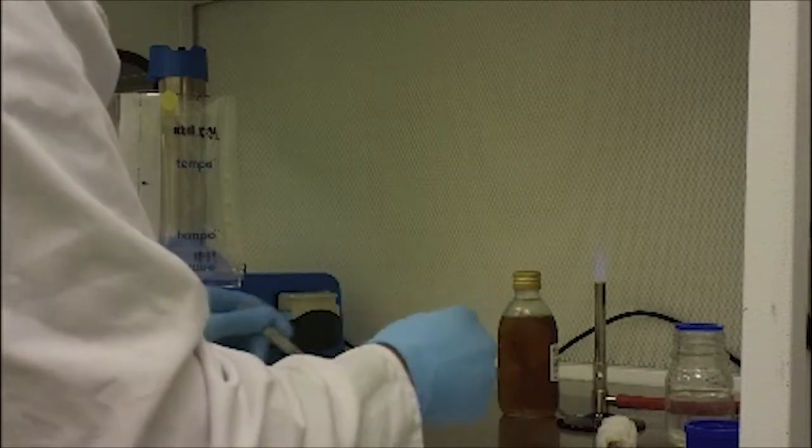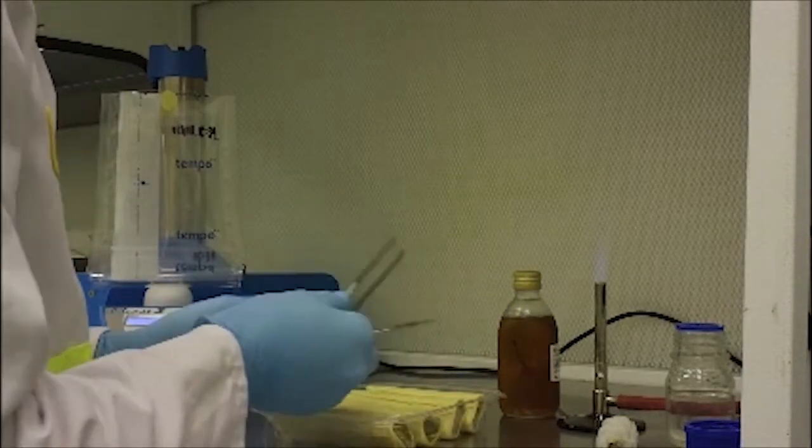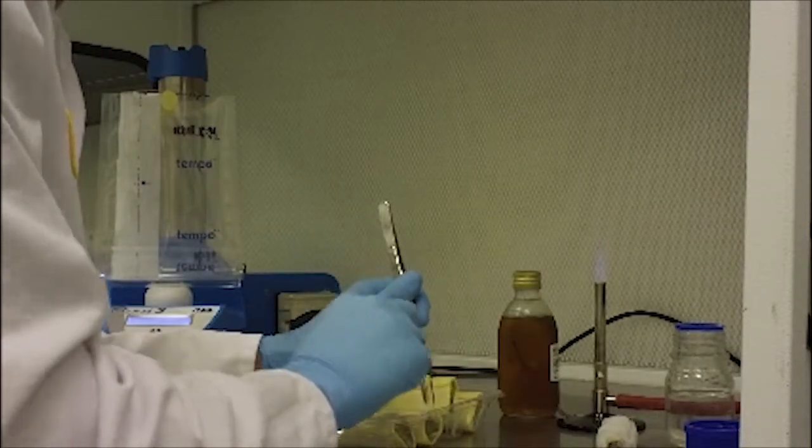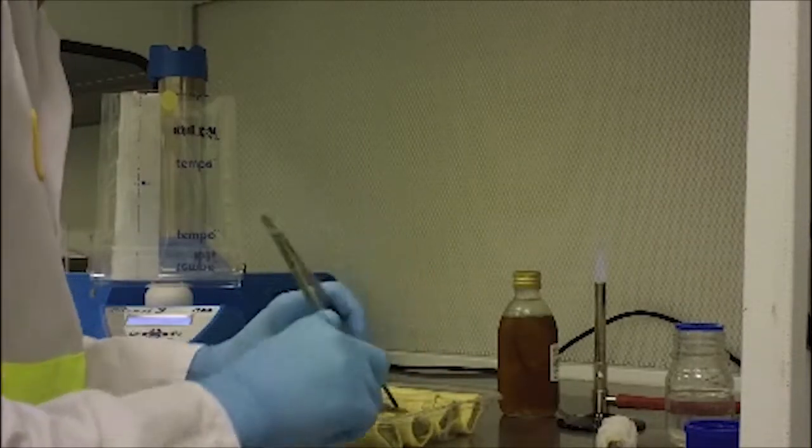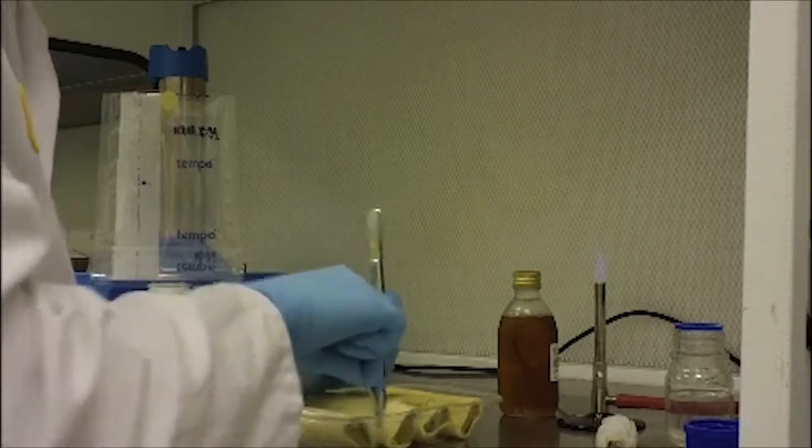This involves making sure that I have a little bit of the sample in a sample bag, and then I create a one-in-ten dilution with an enrichment broth which will essentially allow the bacteria to grow over the 24-hour incubation period.